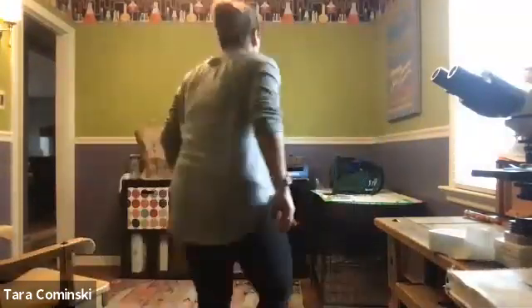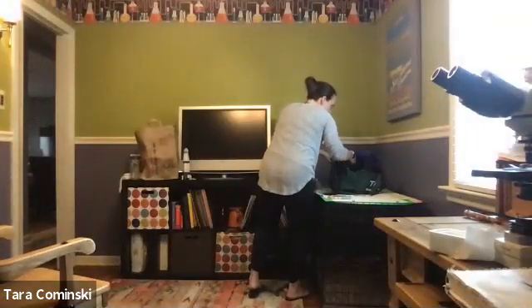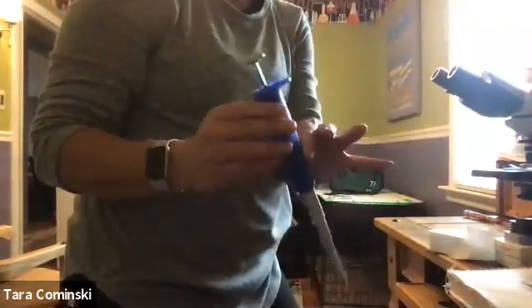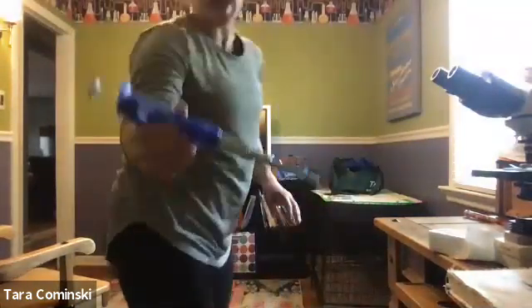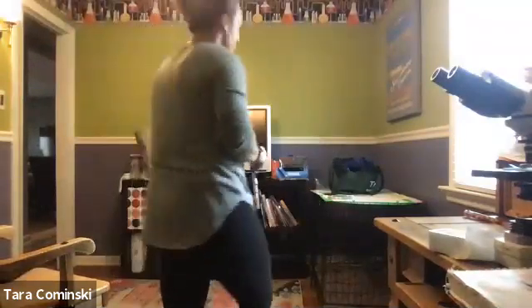I'll show you what we're going to use later in the semester. It's using a micropipette, okay? You've probably seen lots of pictures of people using these. Maybe you've used them before. So this measures small volumes, volumes less than a milliliter. Like I said, we'll talk about these later in the semester. If we were live, you would have a chance to use these, but as you move on, you'll have a chance to use them.